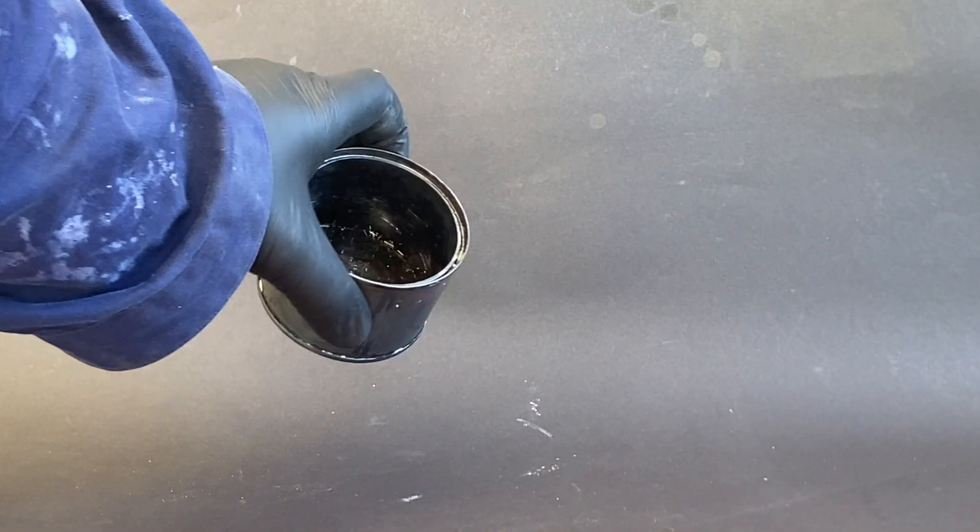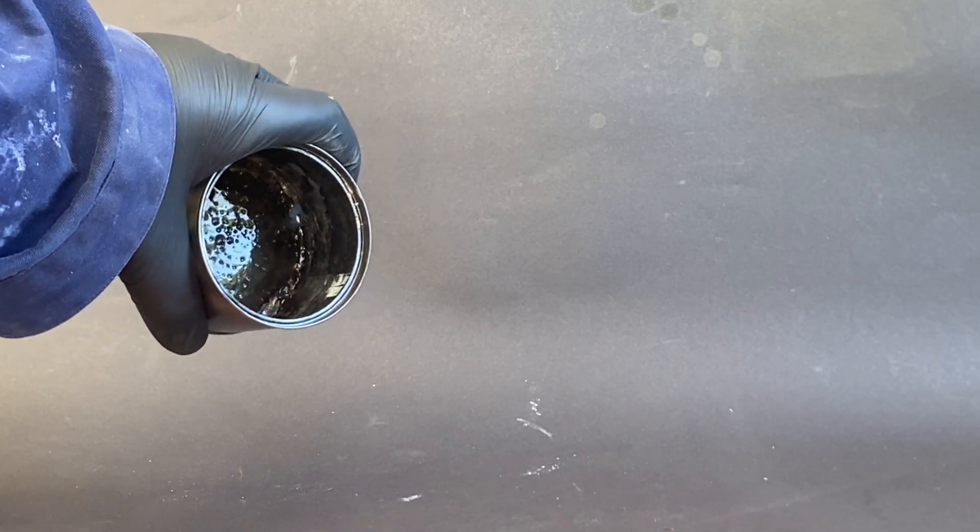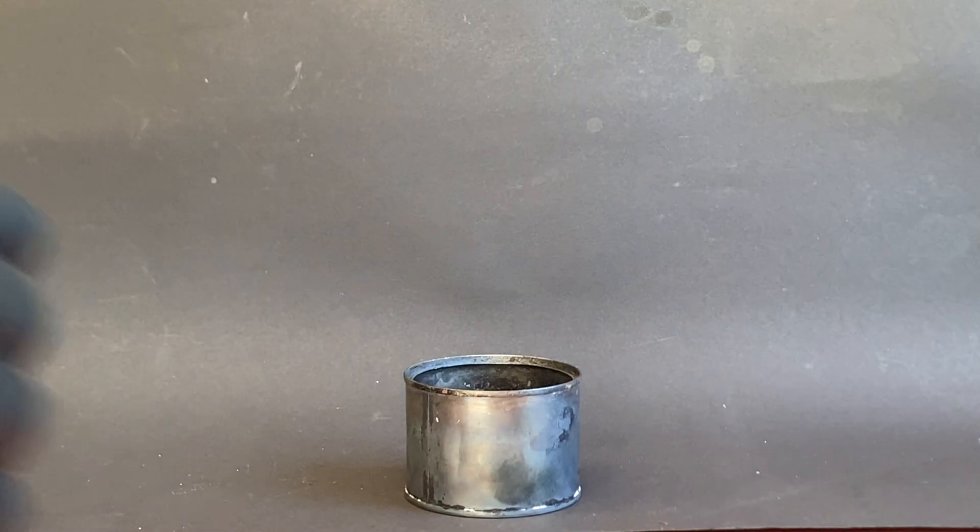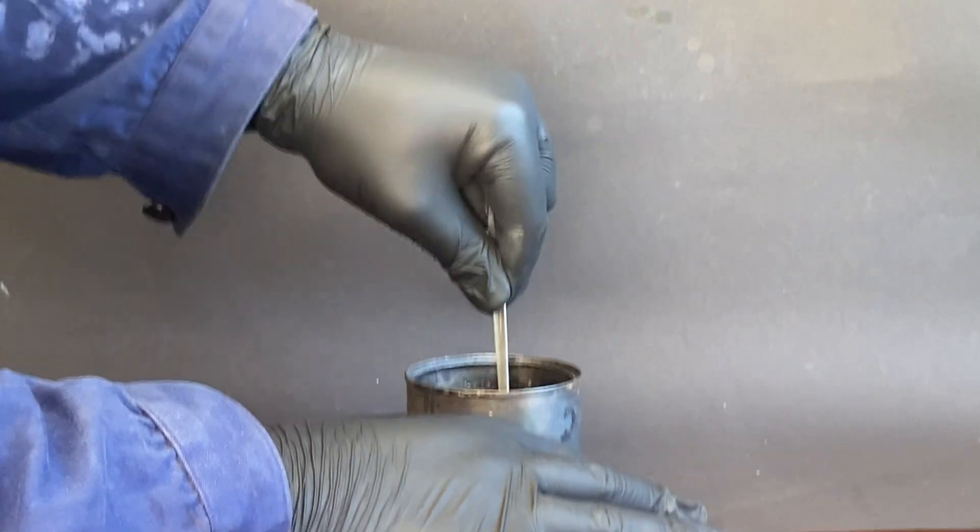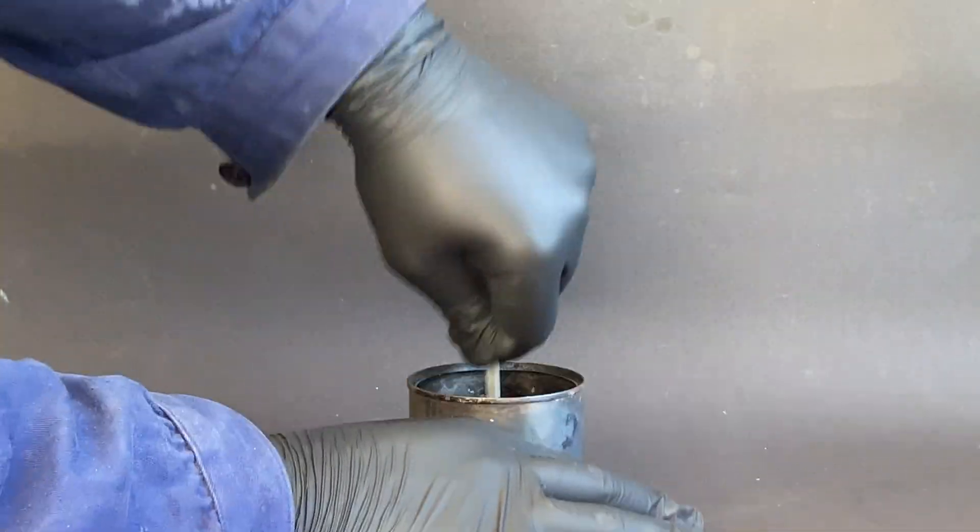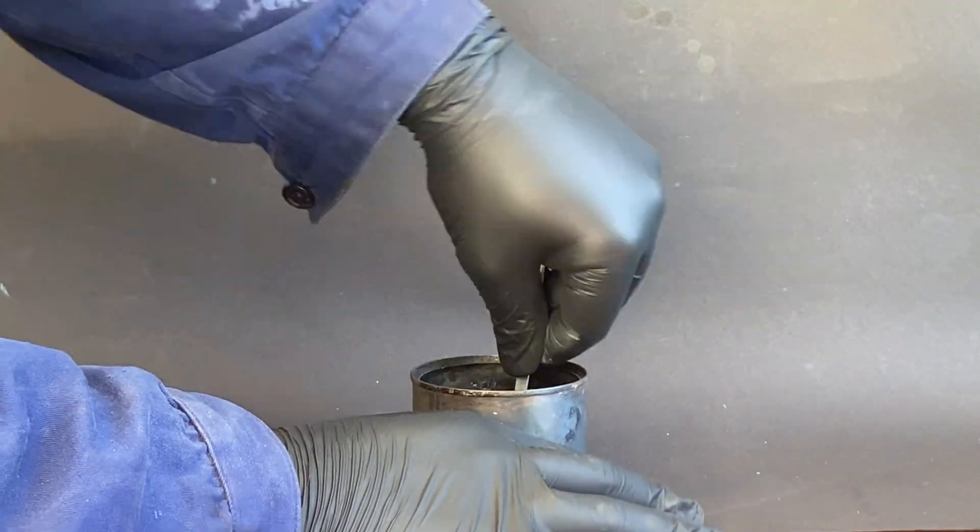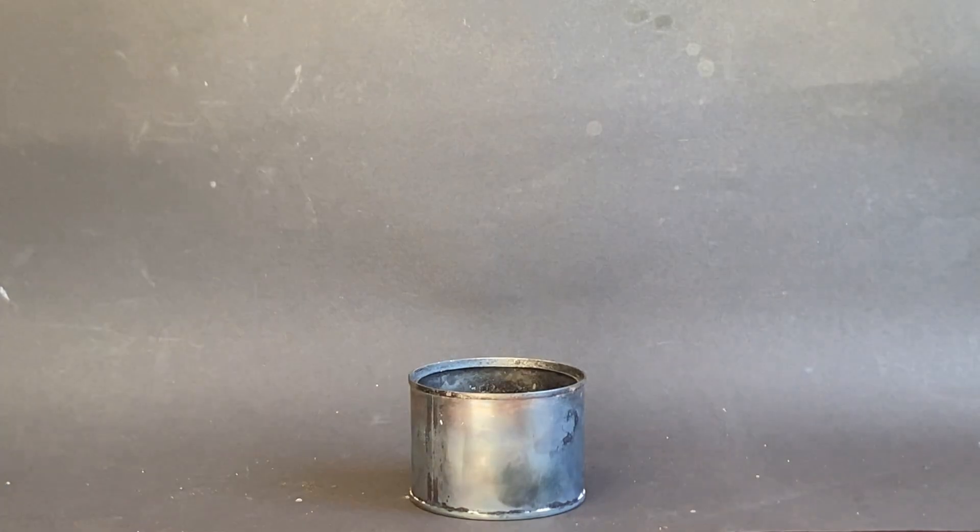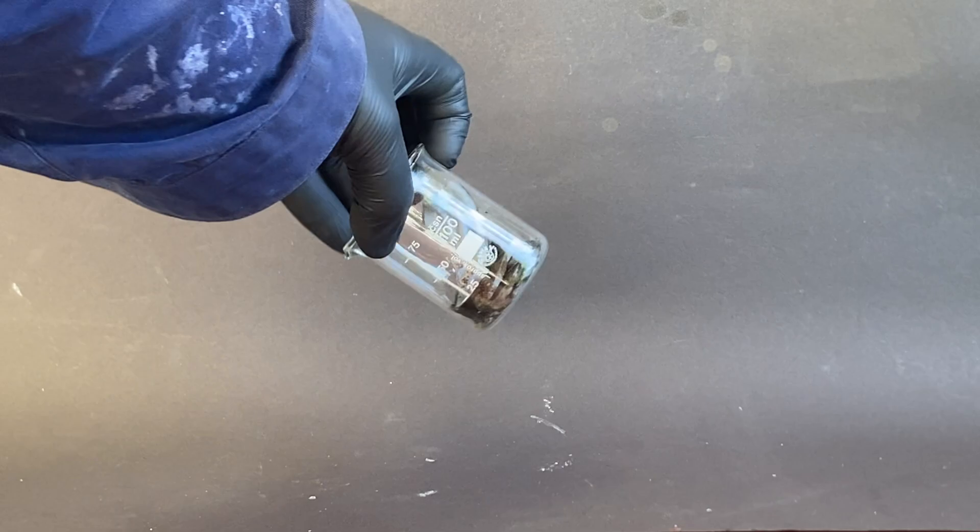After that, I was left with this glass-like material. So I broke it into small pieces, which left me with these boron oxide shards.